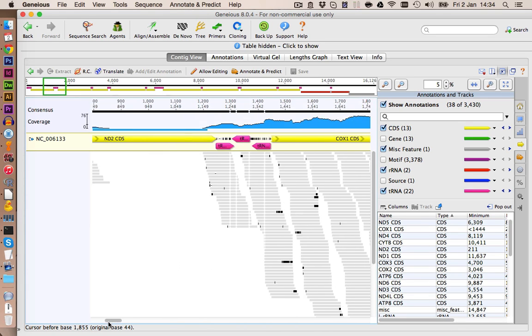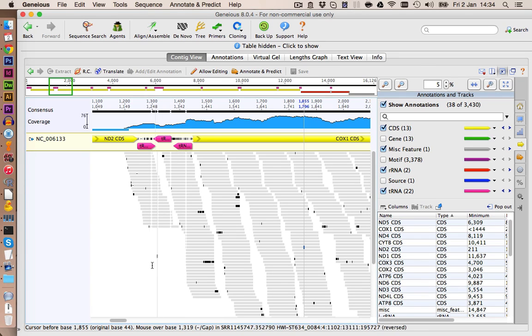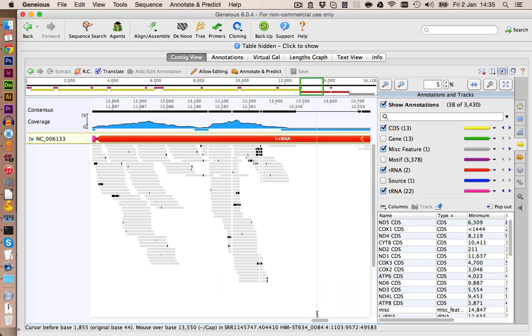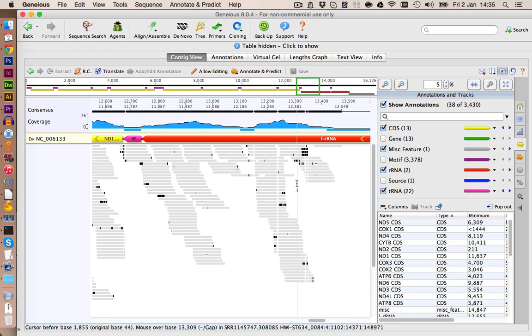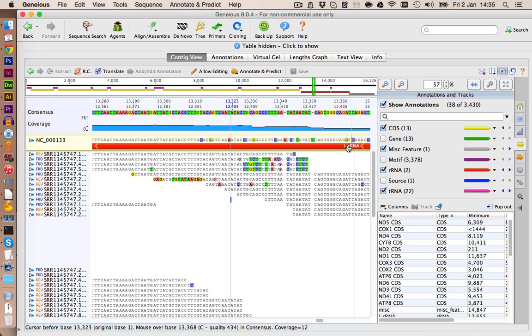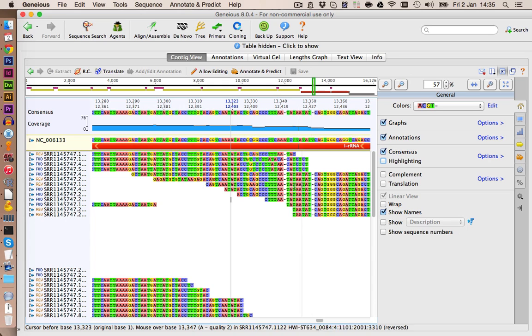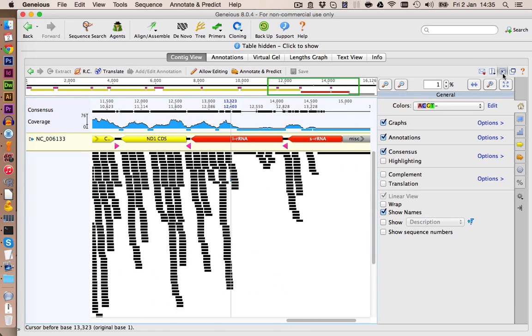Let's take a quick look across the assembled genome to see if there are any problems with the mappings. You might get some gaps in here sometimes due to deletions or insertions, but this isn't really a concern. We don't see any strong systematic mismatches, so I think this is very nice. Maybe let's take a closer look at this one here. If you want to have an idea what is going on, you can also always disable highlighting to get a better picture. Yeah, it might be that we have some problem here with the assembly, but we can probably take care of this later on. Let's zoom out again. And I would say we can close this.